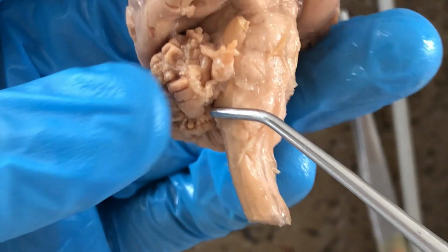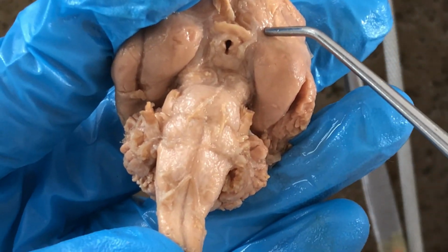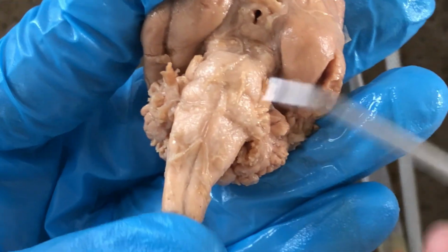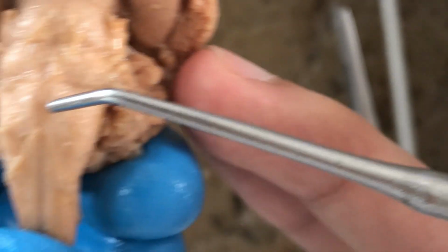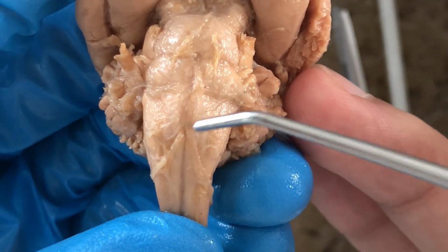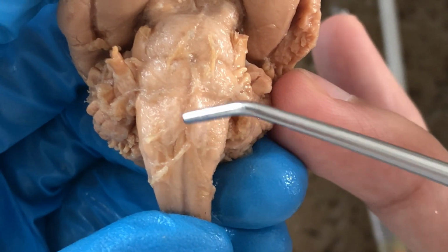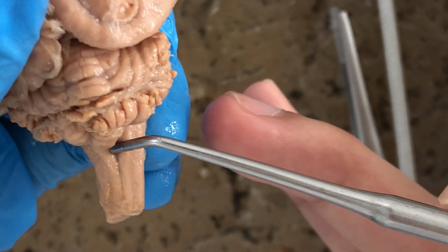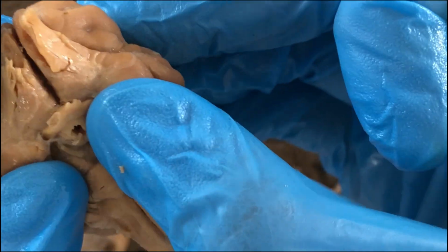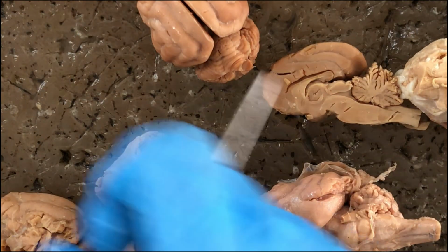And then on the ventral side, you'll see the motor tracts relaying information from the brain to the rest of the body to control the muscles, for example. And we have already seen the pyramids, right? The pyramids of the medulla oblongata, also known as the somatic motor tracts. The pyramids. So motor, ventral, dorsal, sensory. And those would be the clear structures that you can see from this wet specimen of the cat. Let's turn to the plastic models.